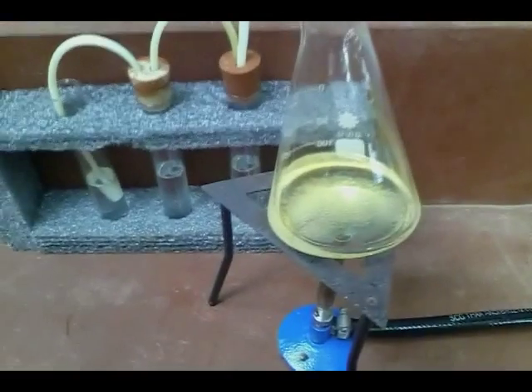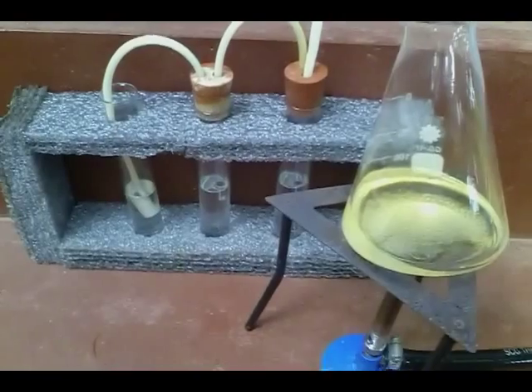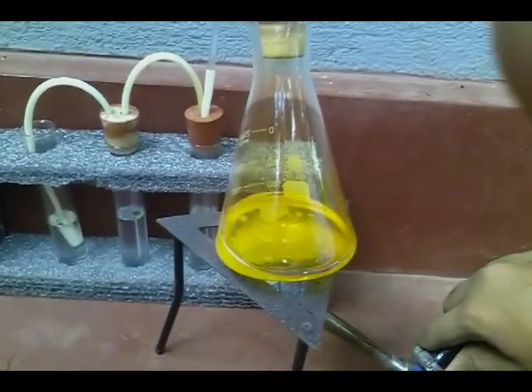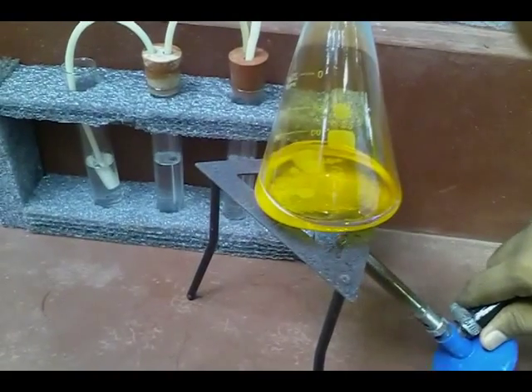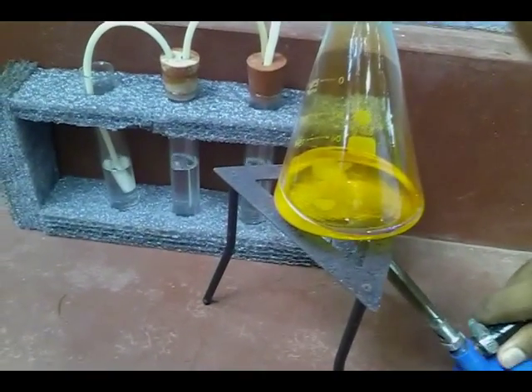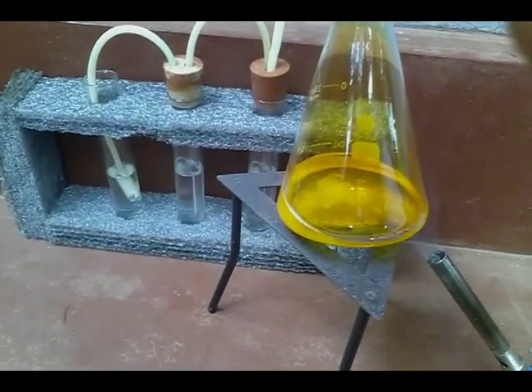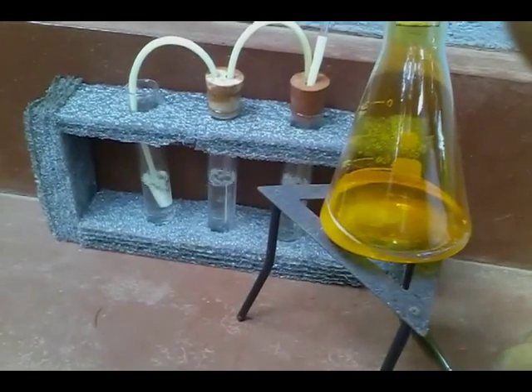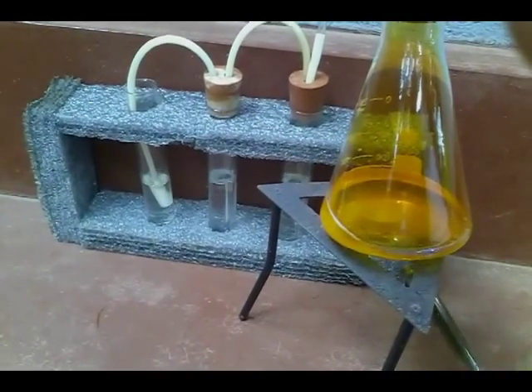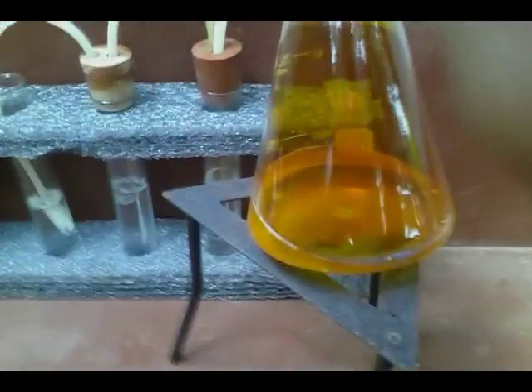Slowly heat the solution. When the reaction starts, you stop the heating. Now you can see the reaction has started and nitrogen dioxide gas is bubbling through the KOH solution.